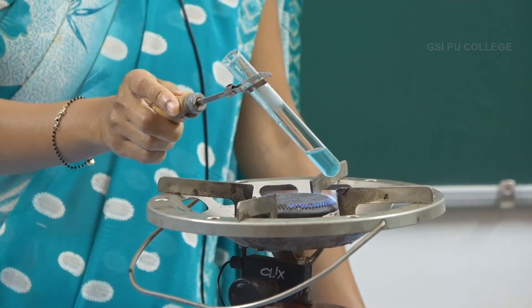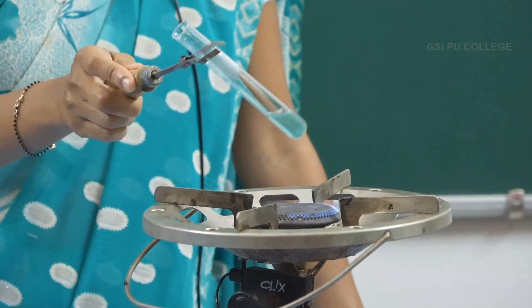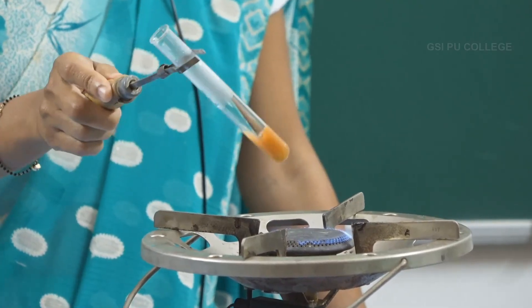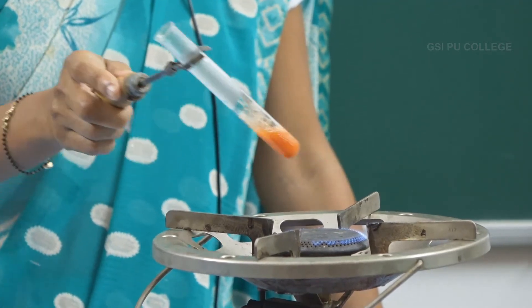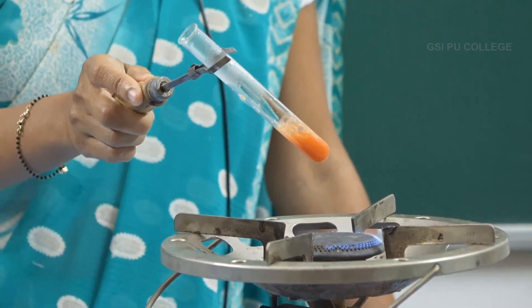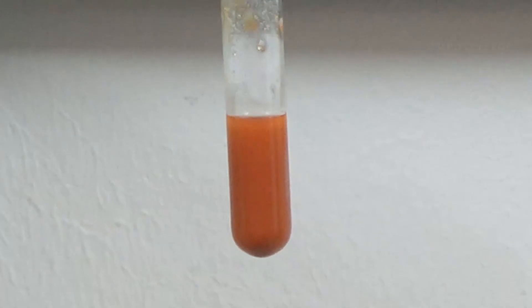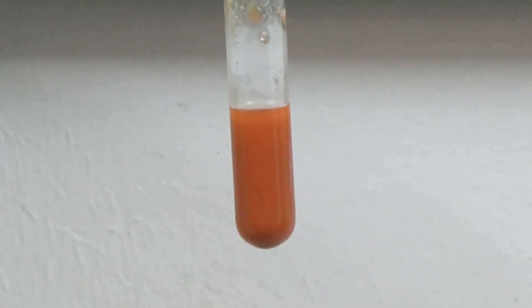If heat is passed continuously, the colour now slowly turns into yellow, indicating the presence of 1% glucose, and slowly it turns into orange, indicating 1.5%. Finally, it gives out brick red colour, indicating the presence of more than 2% sugar. In this test tube, you can see the urine sample contains more than 2% sugar, indicated by the brick red colour.